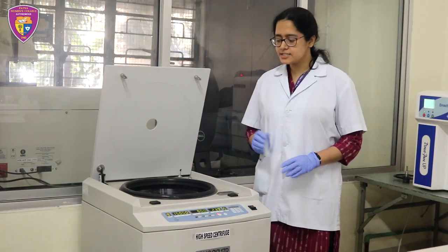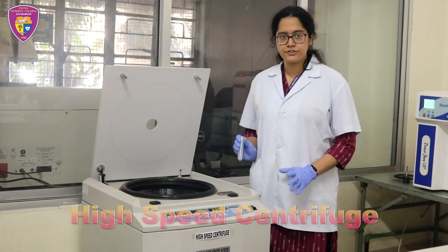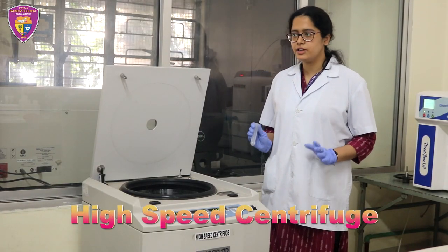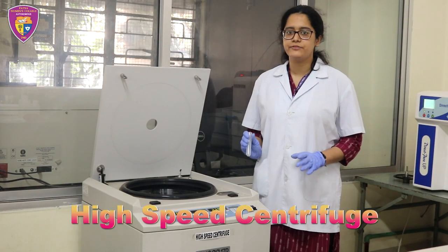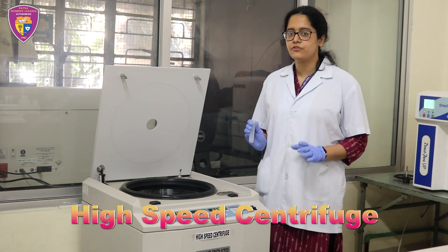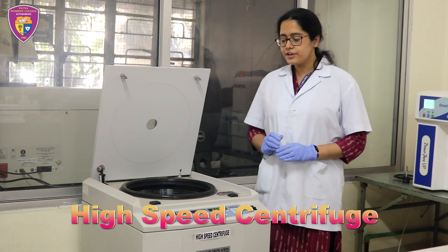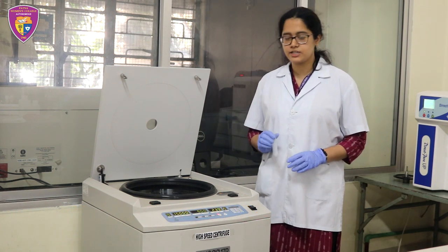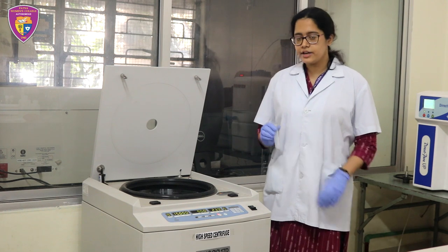This is a high-speed centrifuge. It uses centrifugal force to separate various components of a fluid. It ranges from 5,000 to 30,000 rotations per minute.